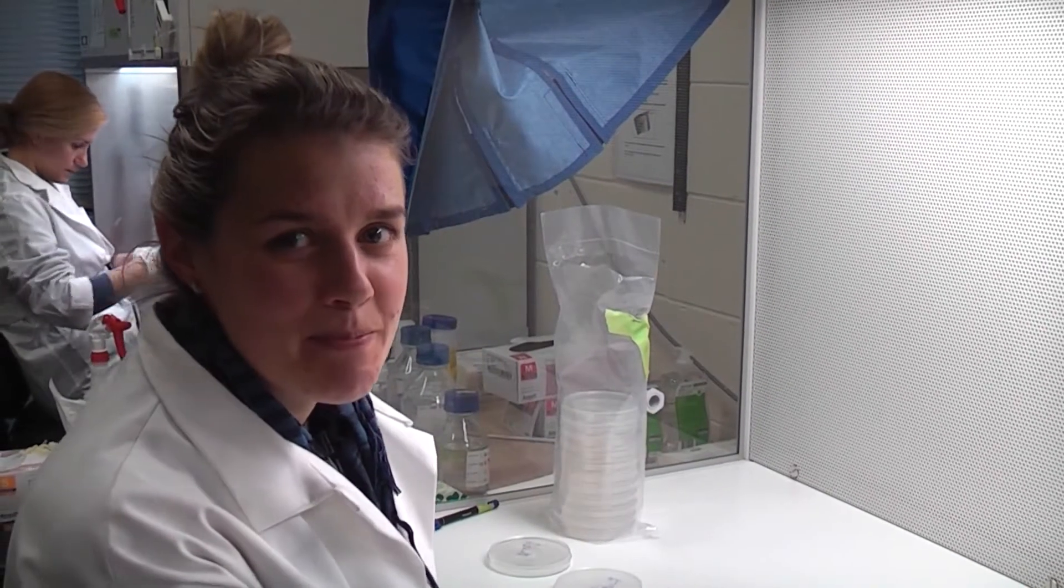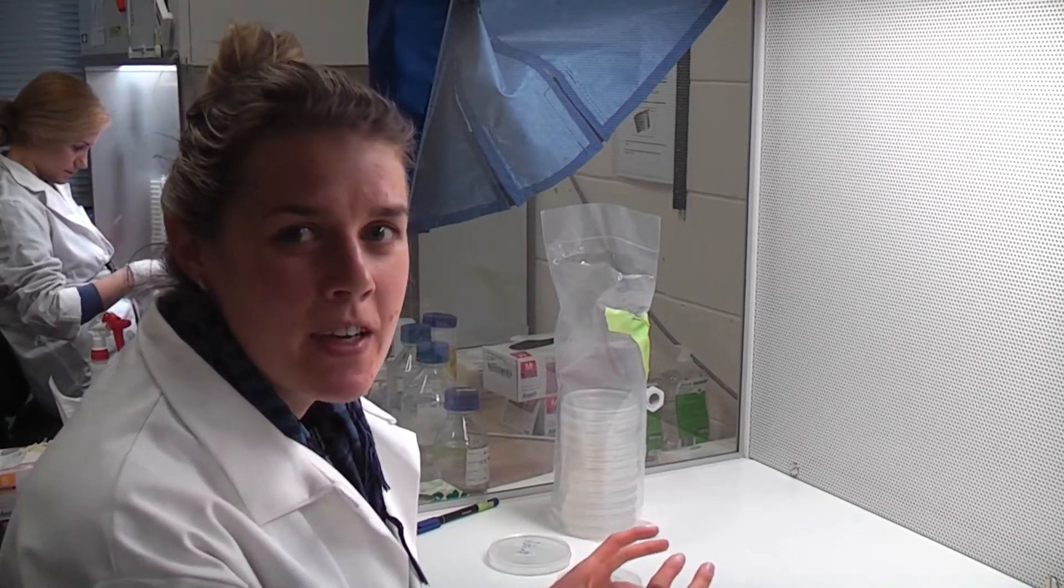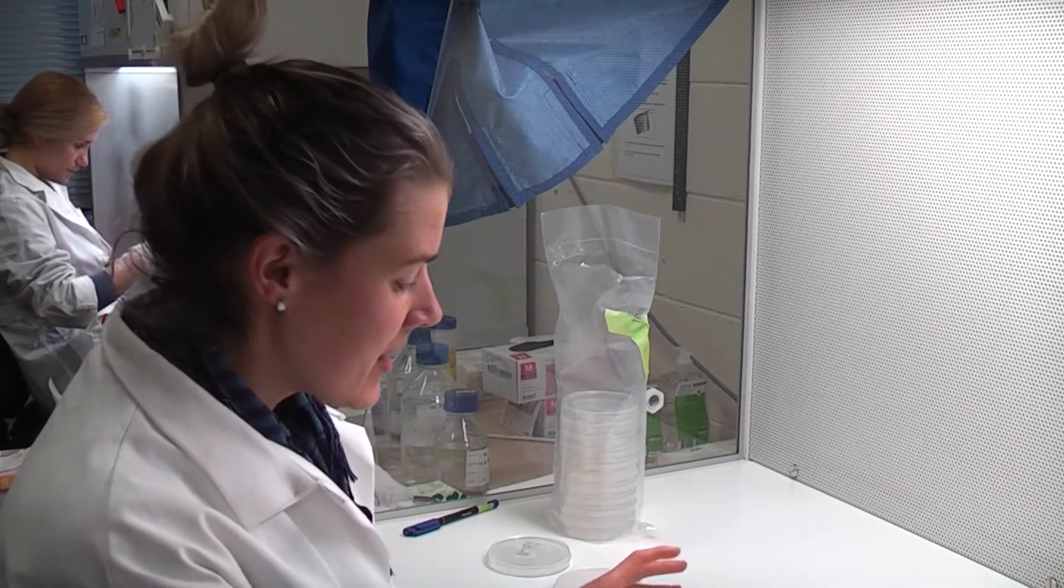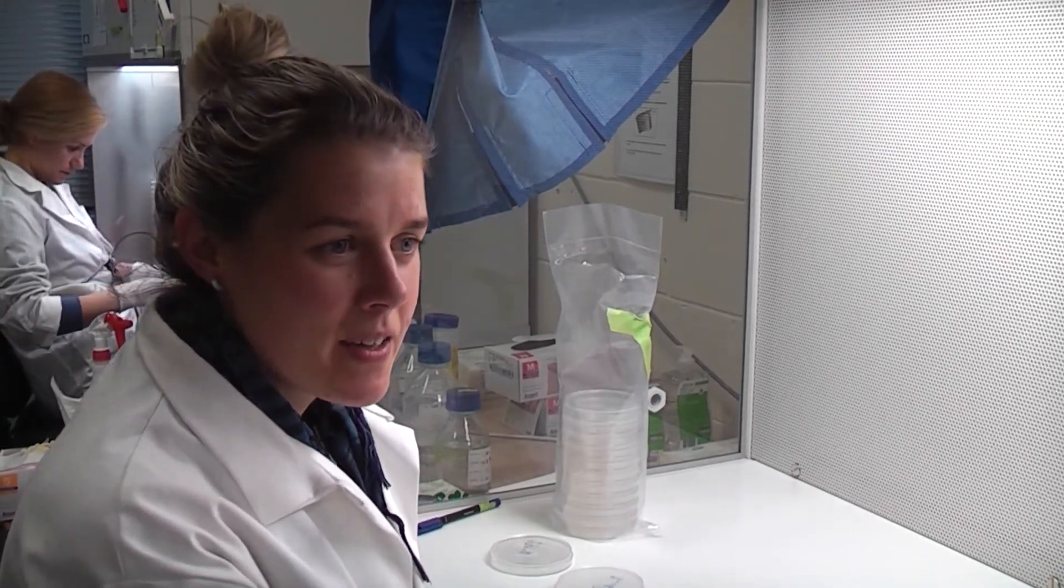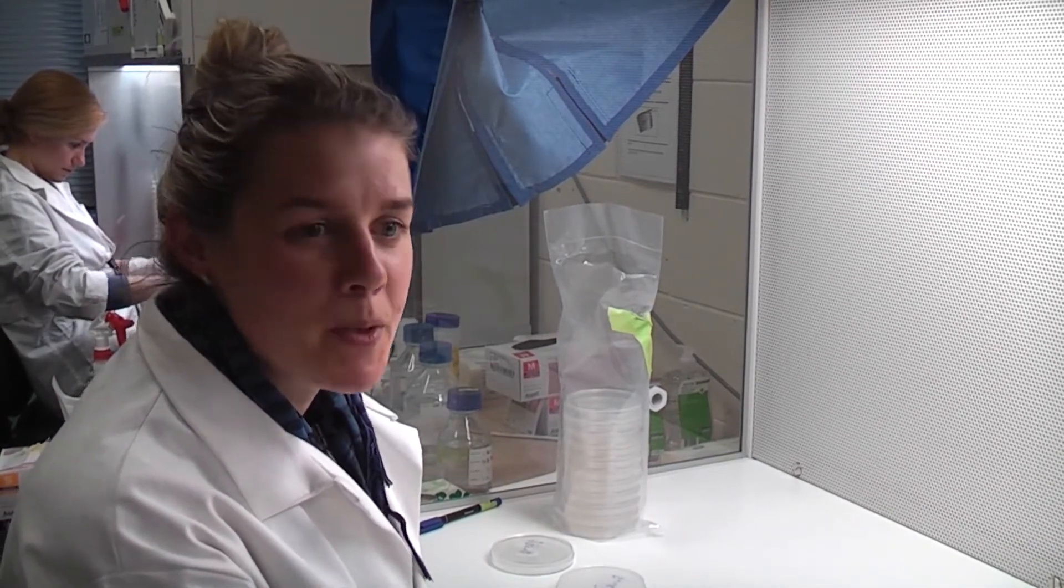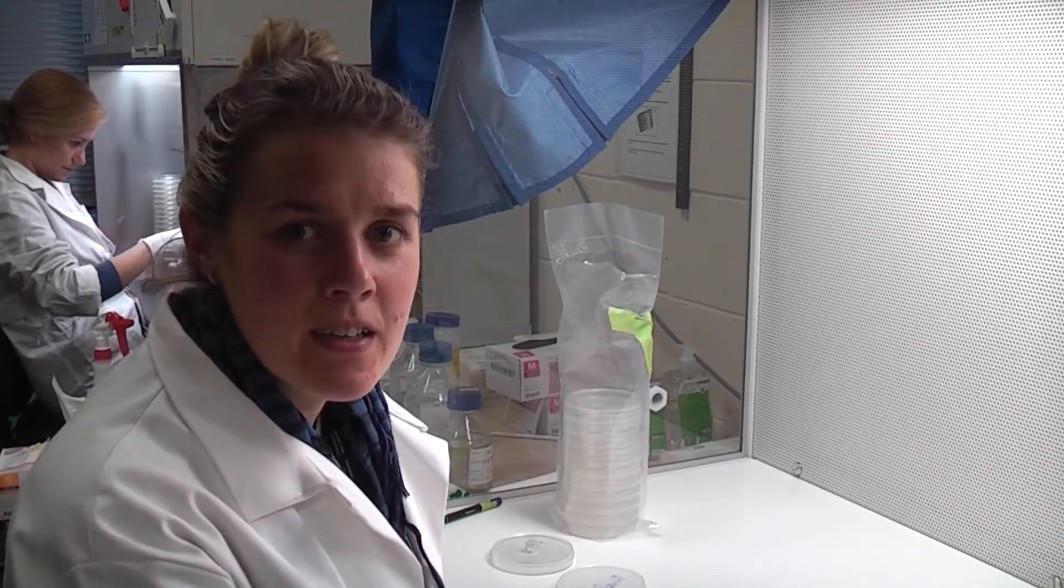Hi, so in a previous video Travis has shown you how we get the rhizobia out of the nodules and onto the plates. Today I will be showing you how we take a sub from the original plate and put it onto a new plate in order to get a clean culture.